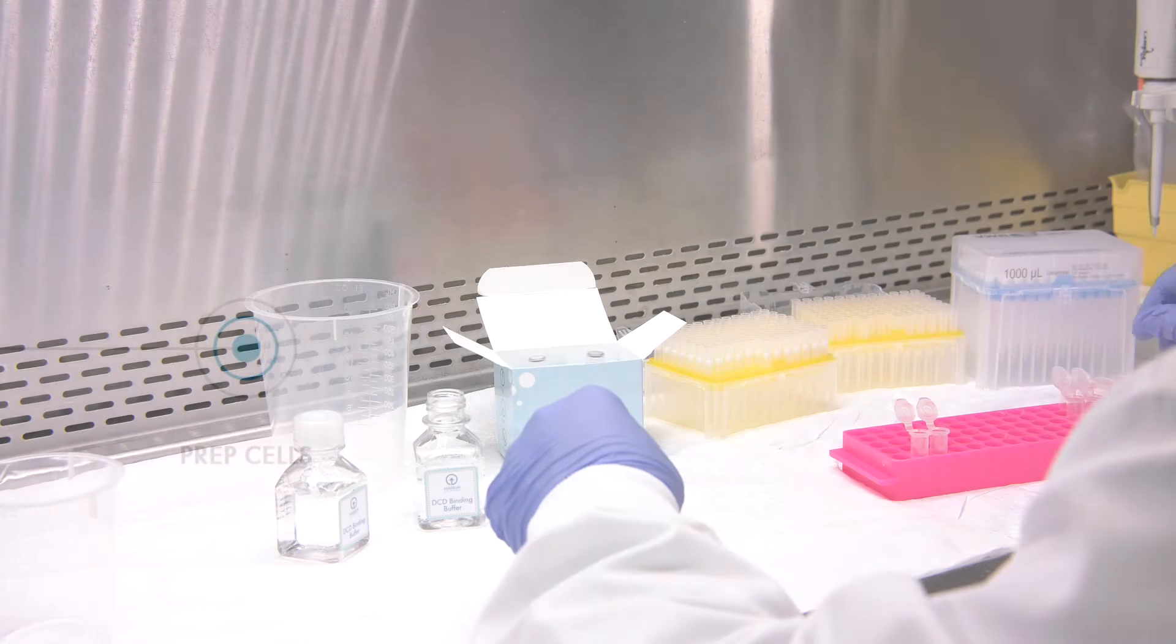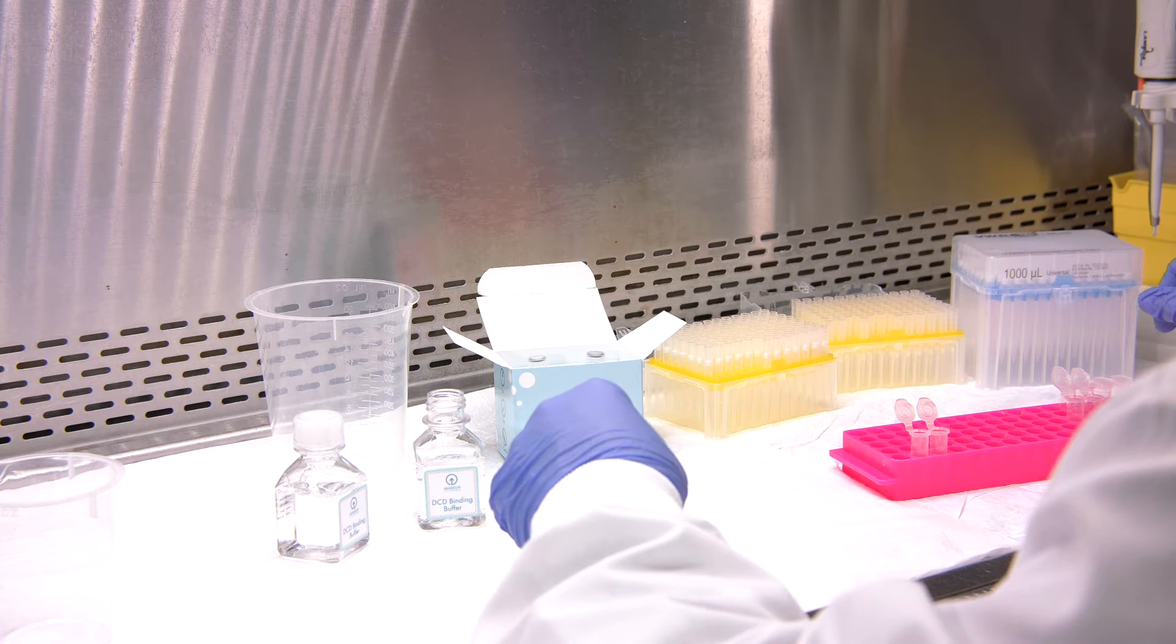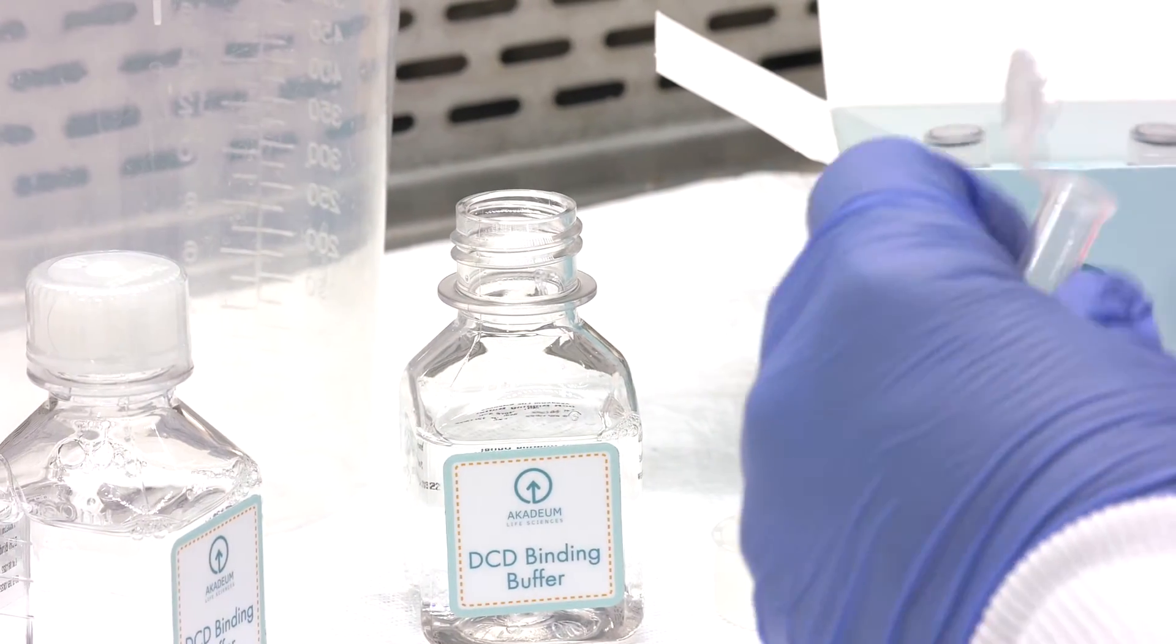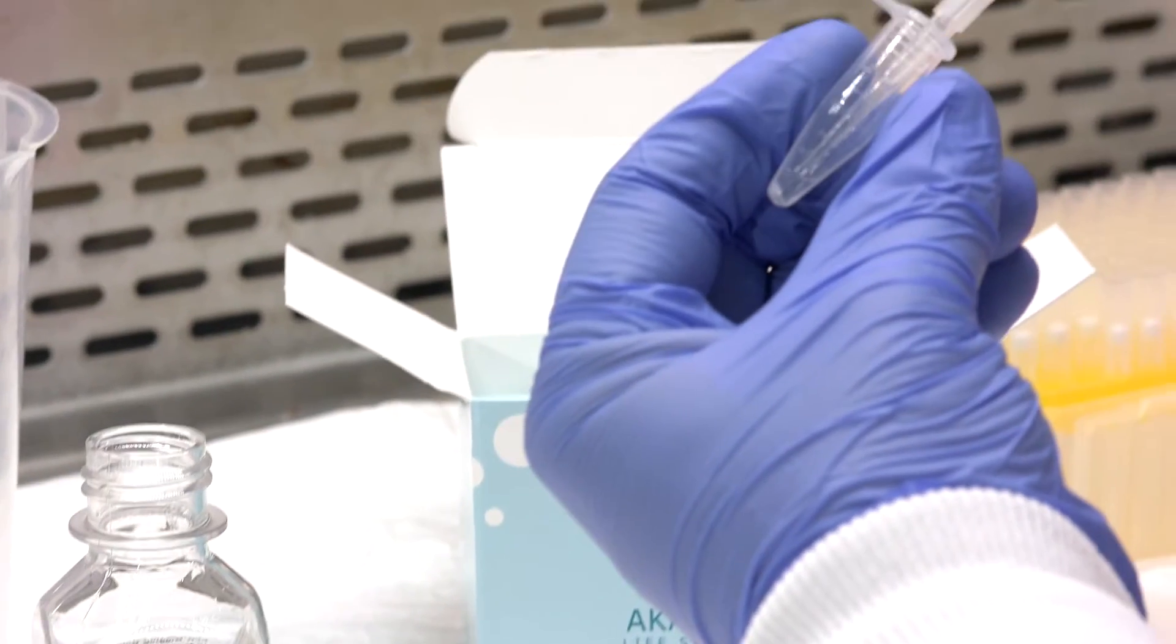Once you have your cells prepared and in a single cell suspension, you're going to want to centrifuge those, and then we will resuspend them in dead cell remover binding buffer.